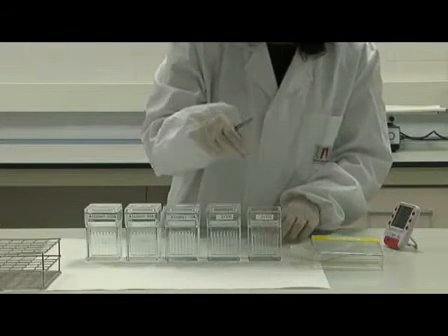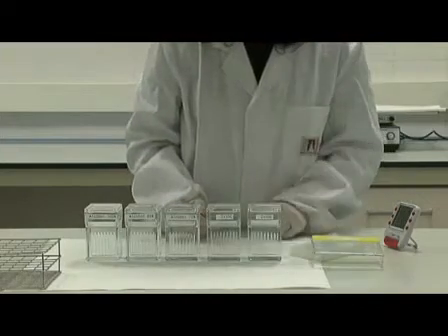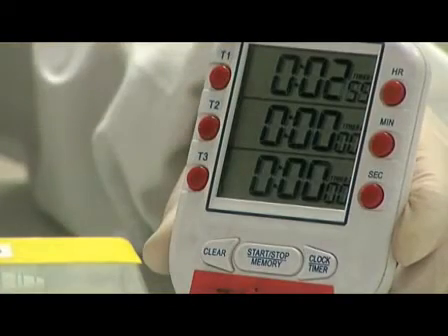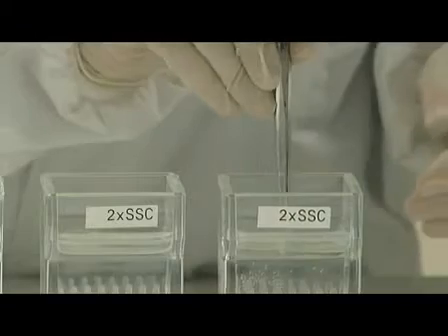When the slides have been defrosted, the fixed samples must be washed and dehydrated by submerging them in two consecutive Coplin jars containing two times SSC. This will take three minutes for each Coplin.